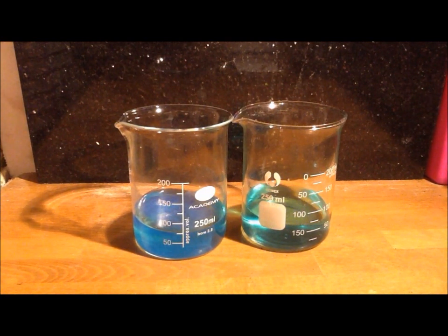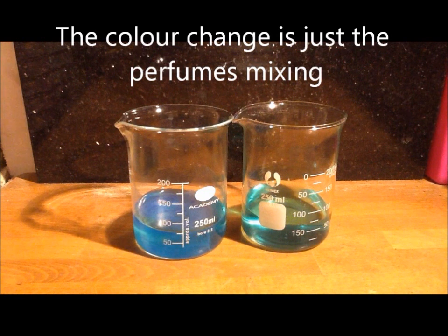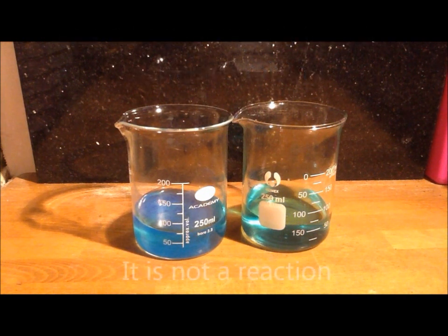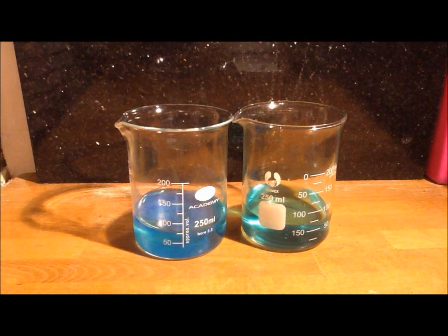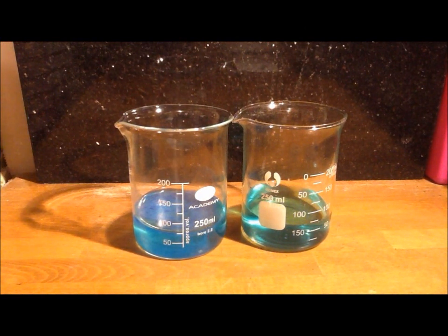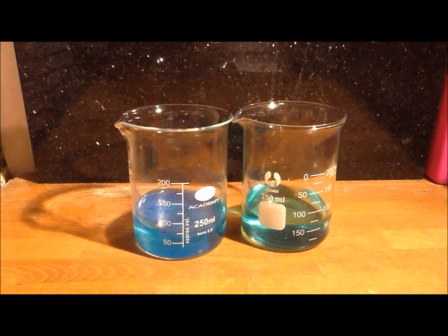And you can see that no reaction is taking place. This indicates that the bleach is not chlorine and therefore is most probably oxygen.